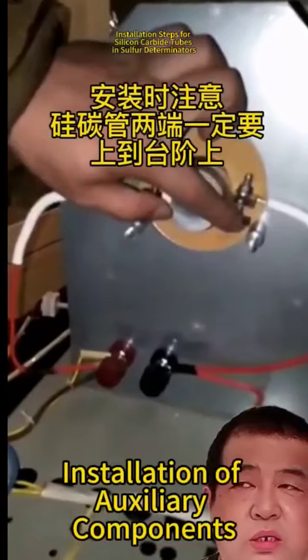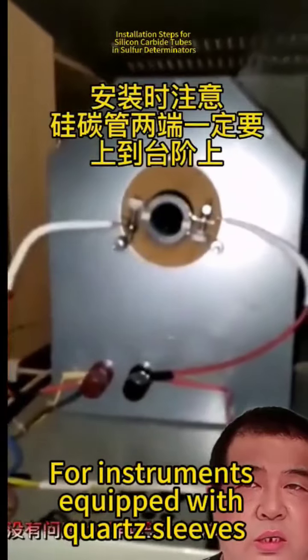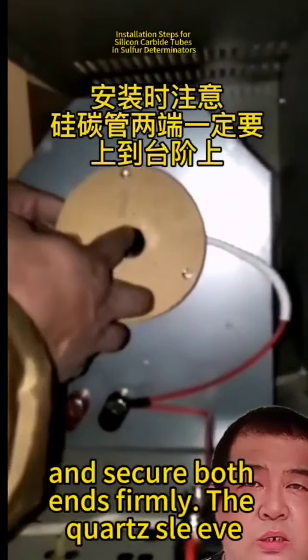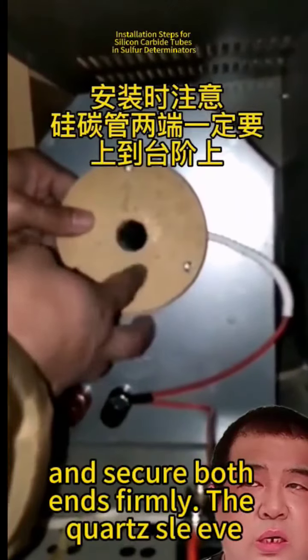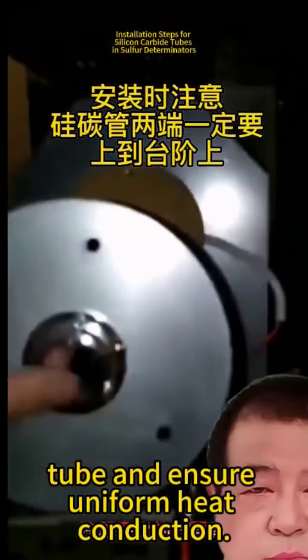Installation of auxiliary components, if applicable, for instruments equipped with quartz sleeves. Insert the sleeve into the silicon carbide tube and secure both ends firmly. The quartz sleeve serves to protect the silicon carbide tube and ensure uniform heat conduction.